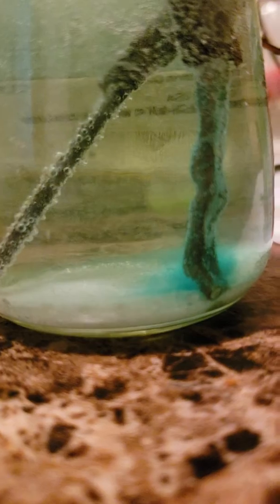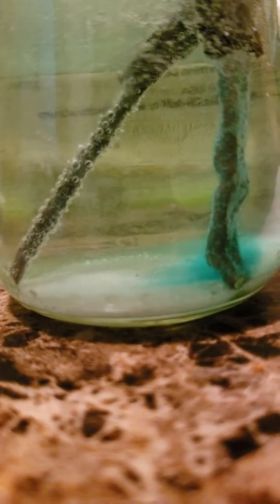I'm using a 9-volt battery. It's going to take a while, but hopefully I can extract all the copper 2 I need because I'm trying to grab iron and mix it with the copper.